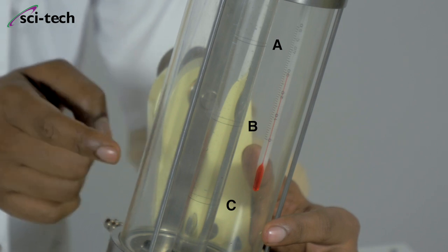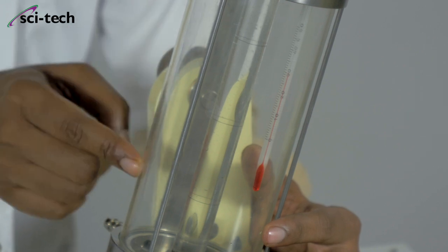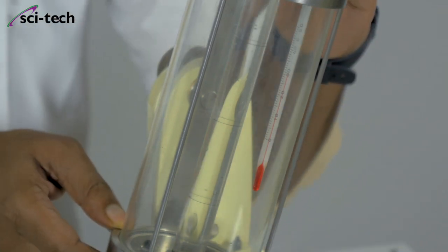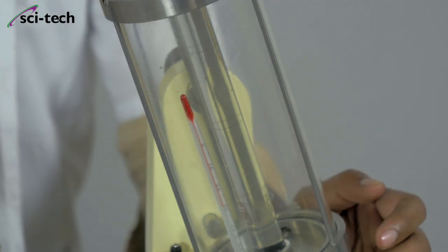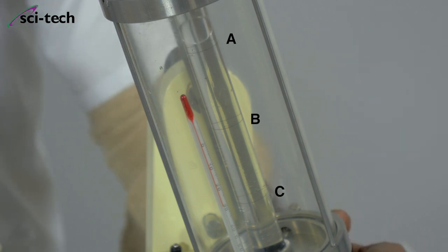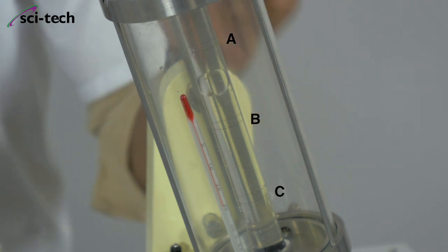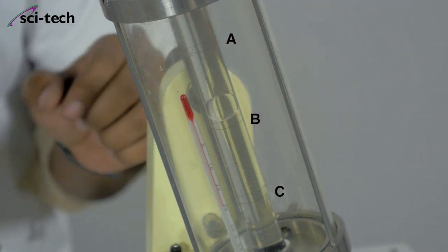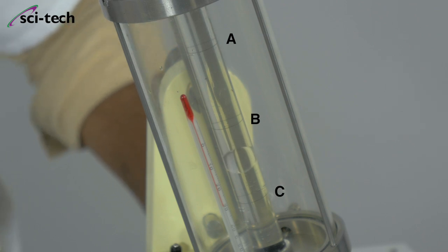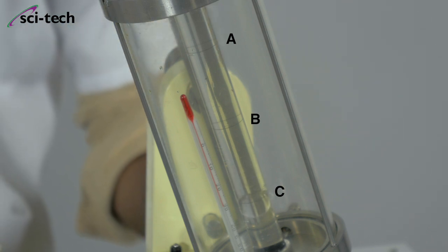When we need to start the stopwatch and when to stop it: when the ball reaches ring A, we start the stopwatch, and when the ball touches ring C, we stop it. Setting it at 10 degrees, the ball slowly comes down and I start the stopwatch at ring A. The ball goes down smoothly inside the Newtonian fluid at an inclined angle of 10 degrees under gravity. It reaches ring B, then ring C — I stop the time. The reading is 24.41 seconds.